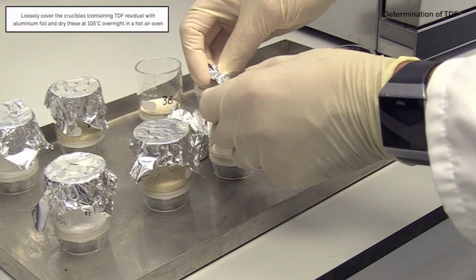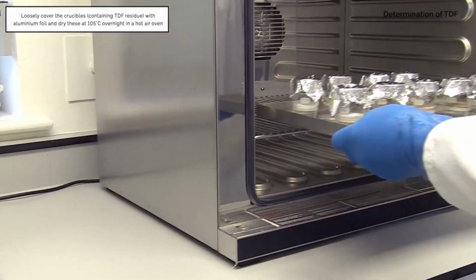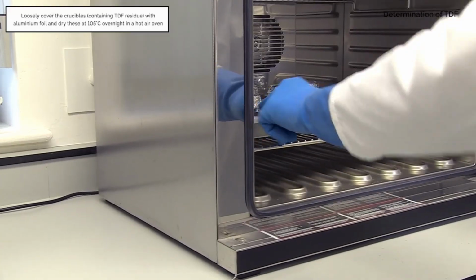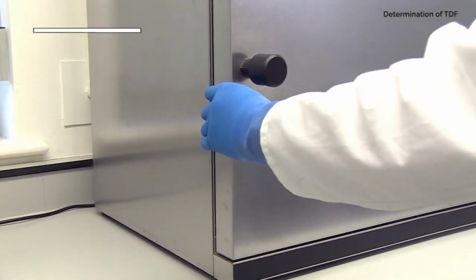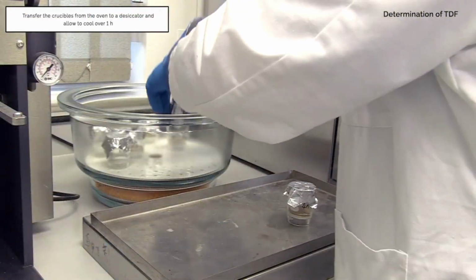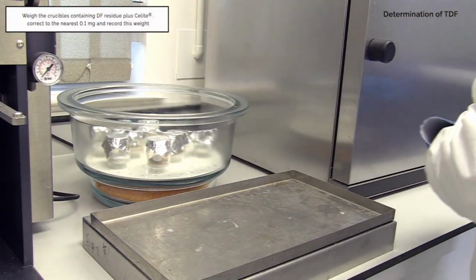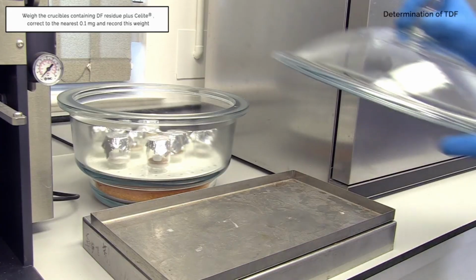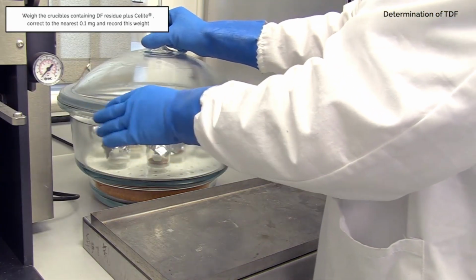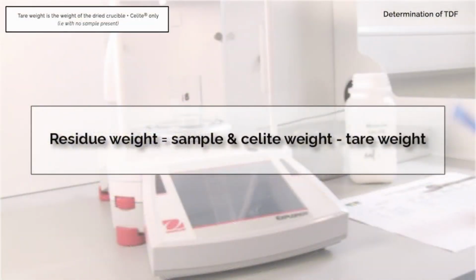Loosely cover the crucibles containing the TDF residue with aluminium foil and dry these at 105 degrees Celsius overnight in a hot air oven. Transfer the crucibles from the oven to a desiccator and allow to cool over 1 hour. Weigh the crucibles correct to the nearest 0.1 mg and record this weight. Use this weight to calculate residue mass by subtracting the tare weight, which is the weight of the dried crucible plus Celite.